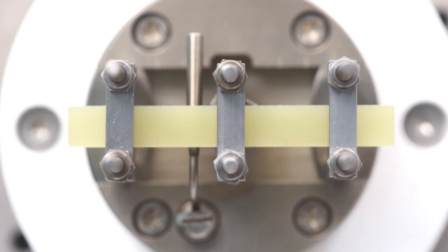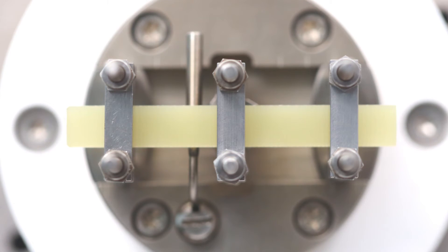Dual cantilever: This has a similar setup to single cantilever, except that the sample needs to be clamped in the center and at both outer ends. This involves the use of an extra outer clamp setup and two nuts.